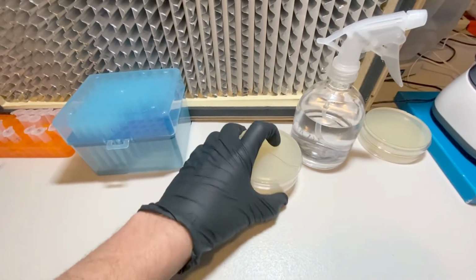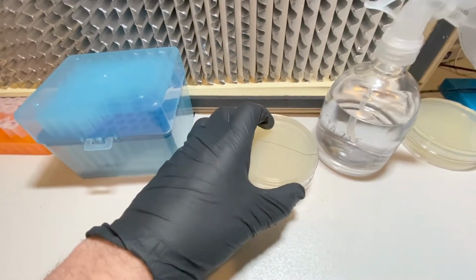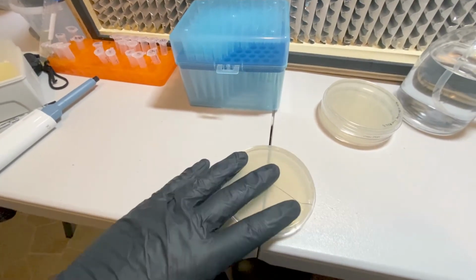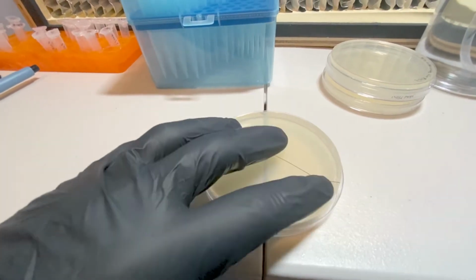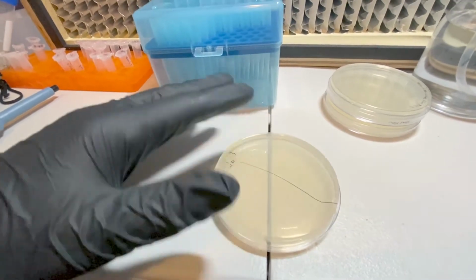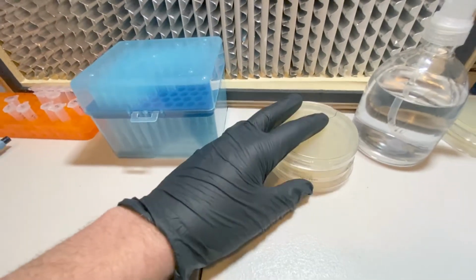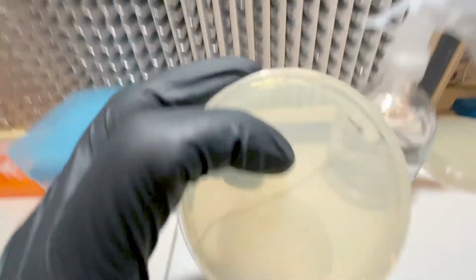One is that perhaps I'm not spreading the antibiotic evenly across the plate. It's very possible that when I spin the plate and turn it, this surface is uneven. You can't really tell, but it wobbles right here. And when I put the antibiotic solution on here, it tends to draw to one side. Even if I spread it with a plate spreader, it will still go to one side. And that's why you always see me move these to a flat surface to get them to dry evenly. And that would mean that those colonies we see along the edges are not actually transformed.